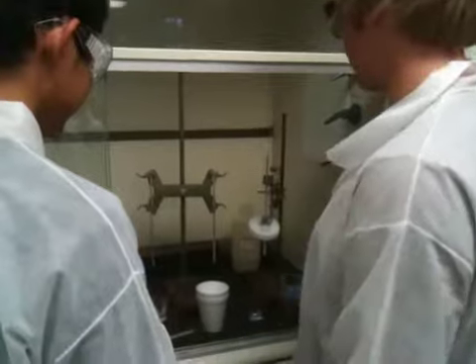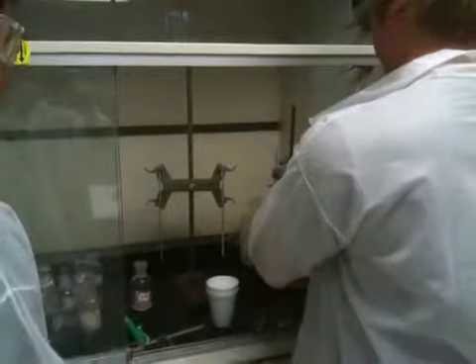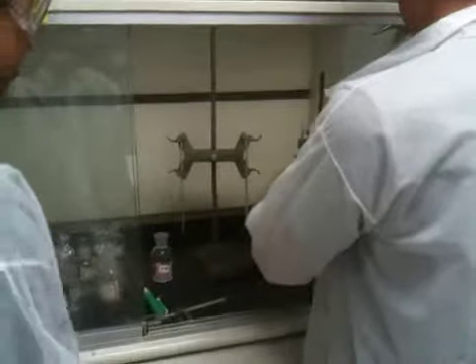We've got to do it simultaneously. I'm adding, but you have to make sure the thermometer gets in there. Clamp it.